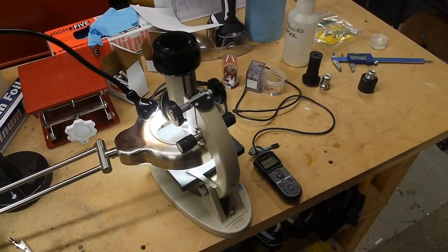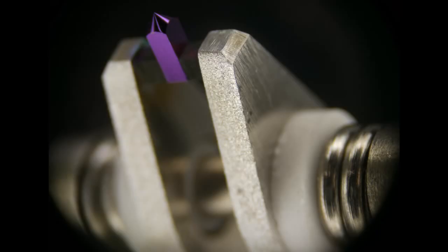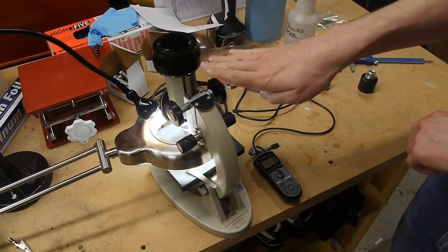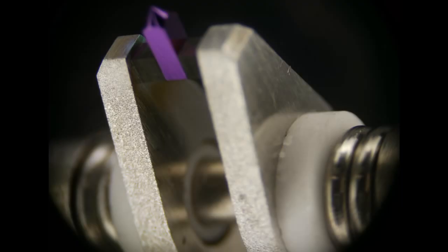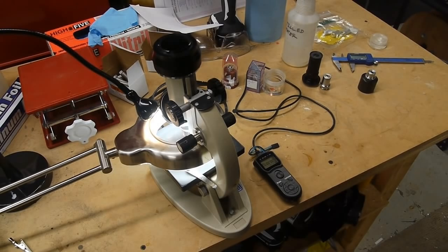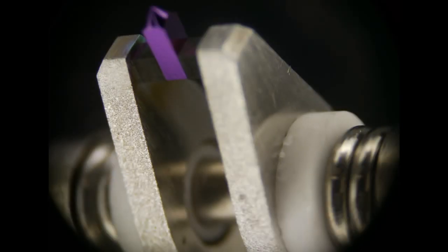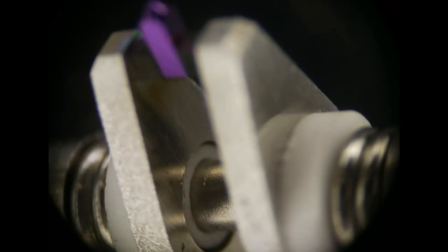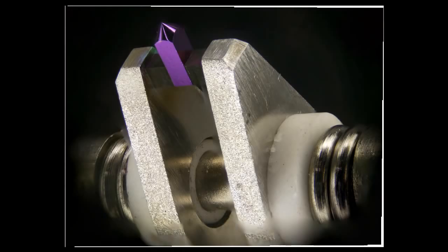And to get around this, what we can do is a technique called focus stacking. So the idea is that you focus at the topmost part of your object and take a picture, and then rack this down a little bit to focus a little further down, and then take another picture and keep going all the way down to the bottom of your image. So you'll end up with something like 10 or 20 images for your average setup, kind of like this. And then you use software to combine all the sharp parts of the images into one nice image.